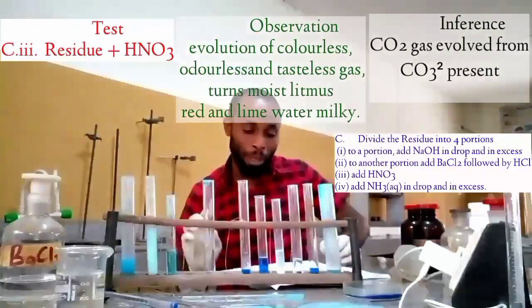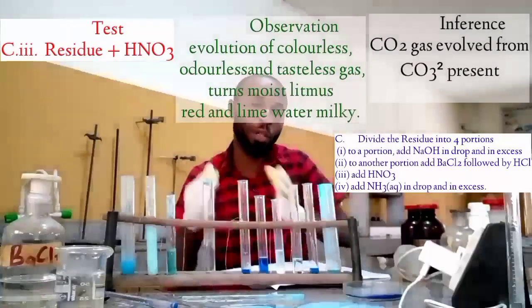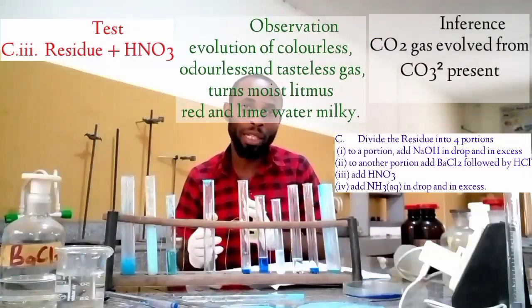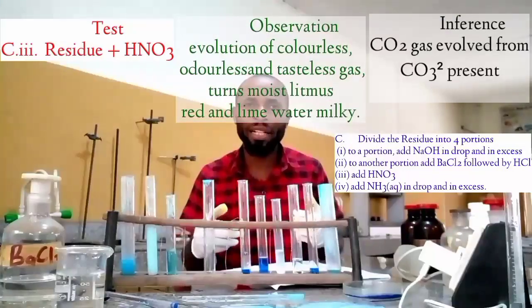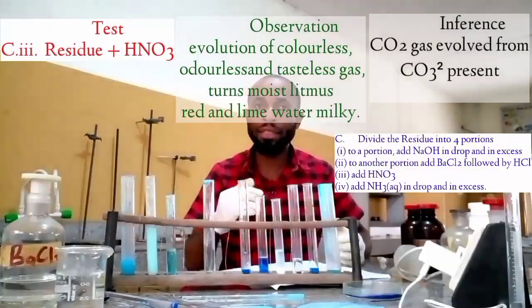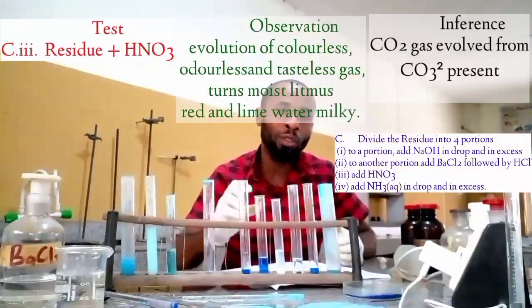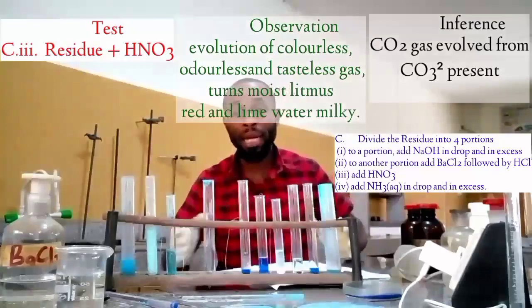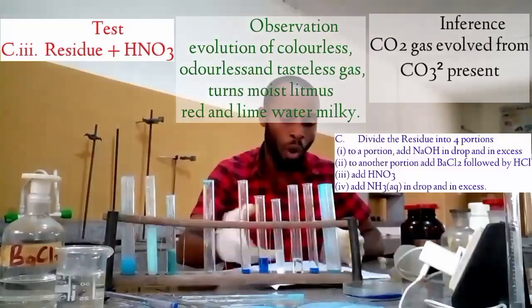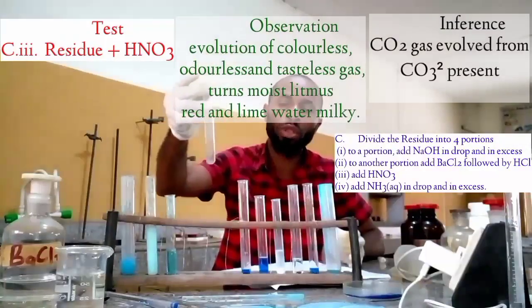Actually, it is a tricky experiment, and what I will tell you is, if you are a teacher, make sure you are close with your students so that they will not panic. And if you are a student, make sure you consult your teacher. But at least, as you can see on the screen, all the possible answers you have to give out are there, and you can still see the work over here. Yet in this, we still have the remaining portion.